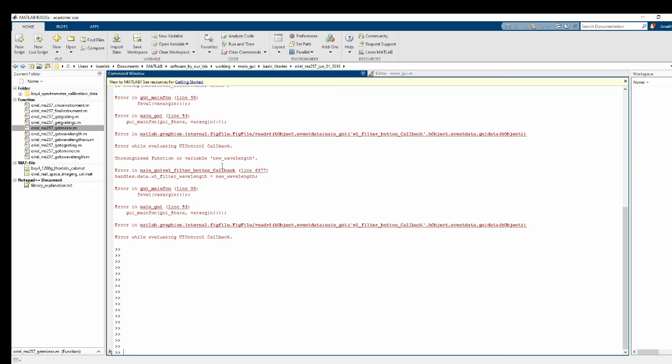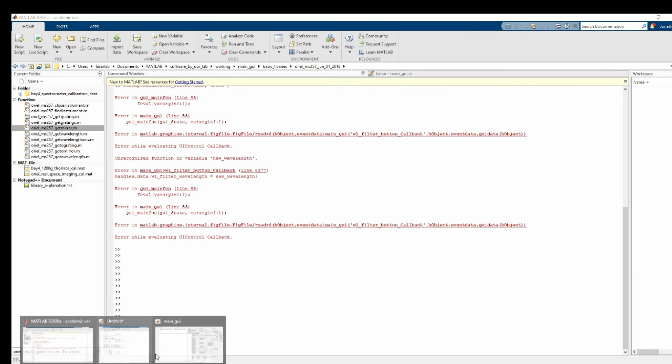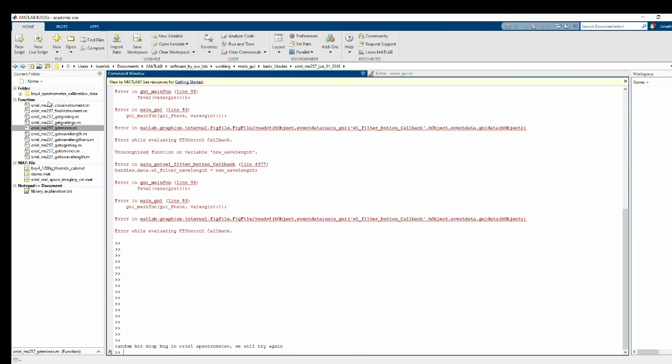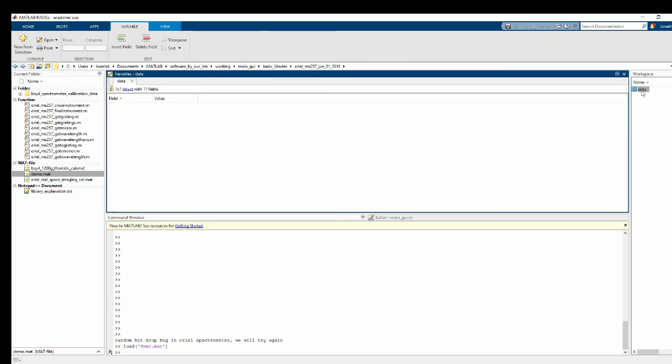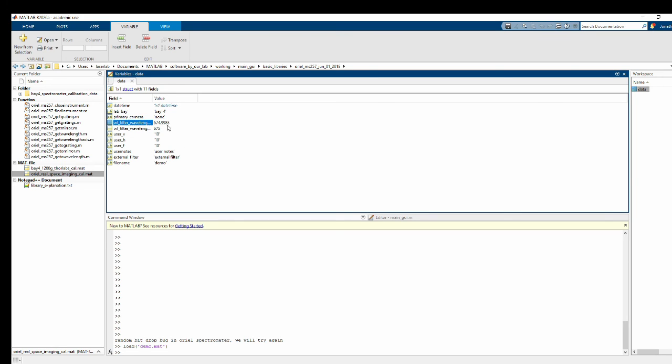Okay, and this should be called current wavelength. There. All right. All right, looks good. Now, if I save this, and I go look at my data structure, I don't have anything about the white light. So now we are going to code in the saving data behavior. Oh, wait a minute. It didn't have anything in there? Oh, it did have something. Okay.